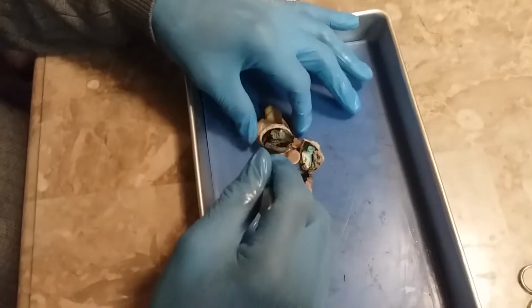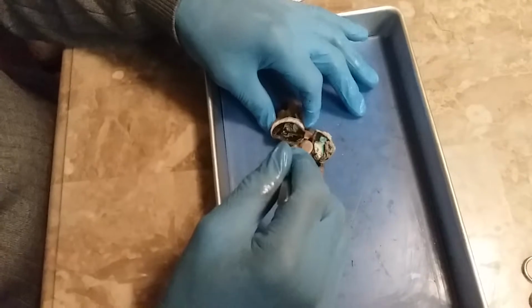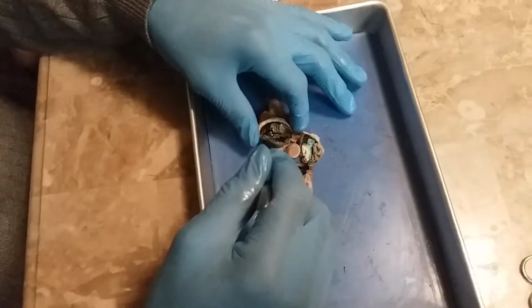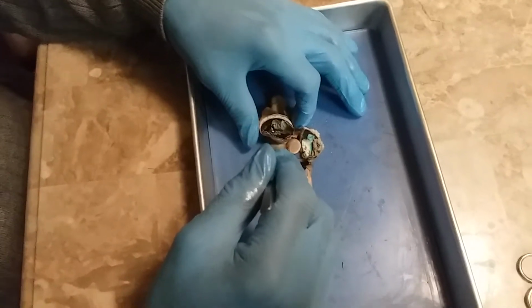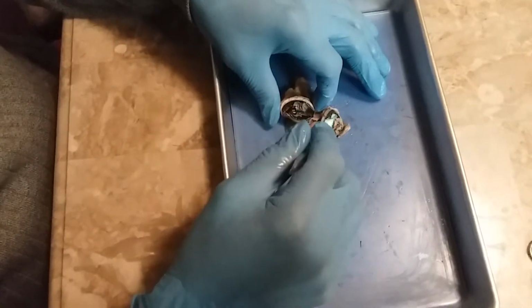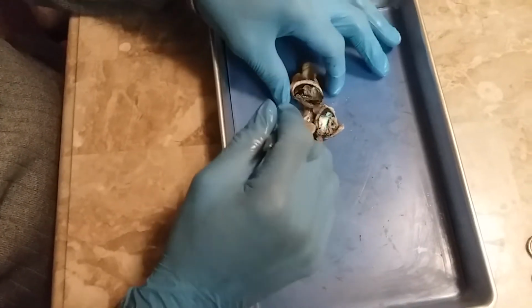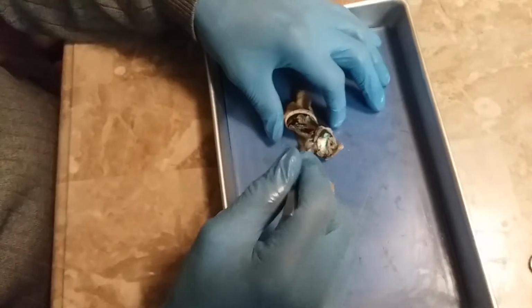The iris is a diaphragm that regulates the size of the pupil. The lens is the transparent structure that focuses the light coming in through the cornea, in the same chamber as we displayed before. And you identify the lens, as we just said.